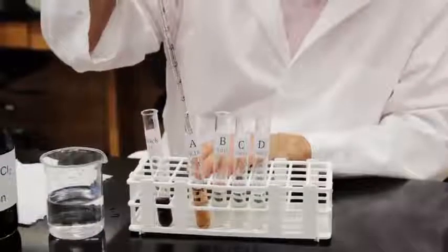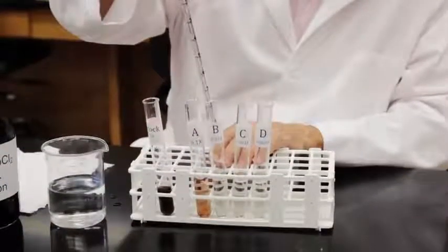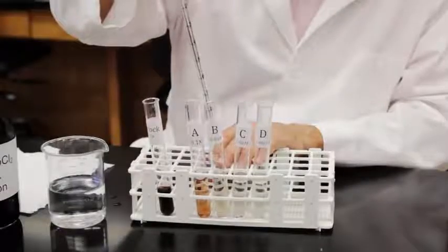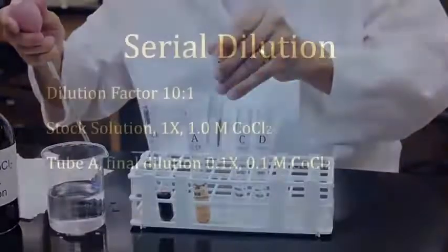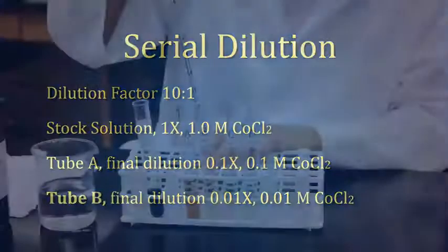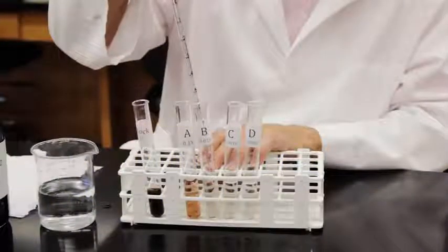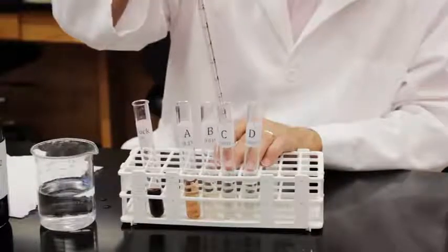Now use a clean pipette to transfer 1 milliliter of solution from tube A to tube B. Mix the contents of tube B thoroughly. Tube B now has been serially diluted by another dilution factor of 10 to 1 down to 0.01x, or 0.01 molar cobalt chloride. Now use a clean pipette to transfer 1 milliliter from tube B to tube C.